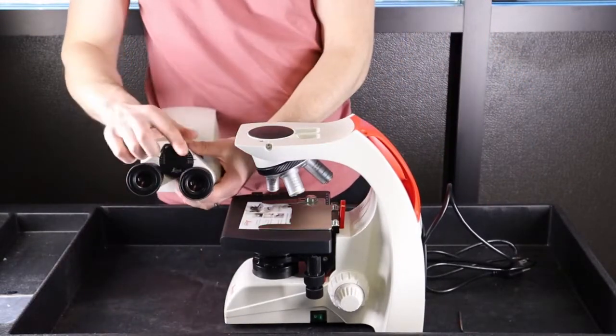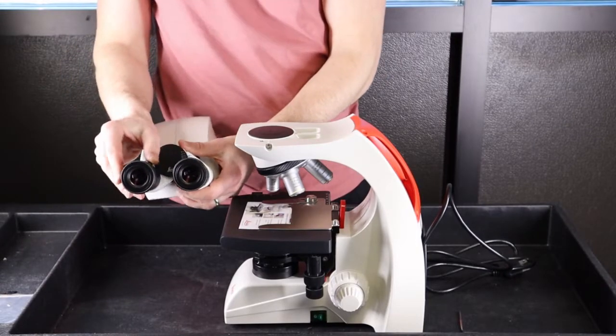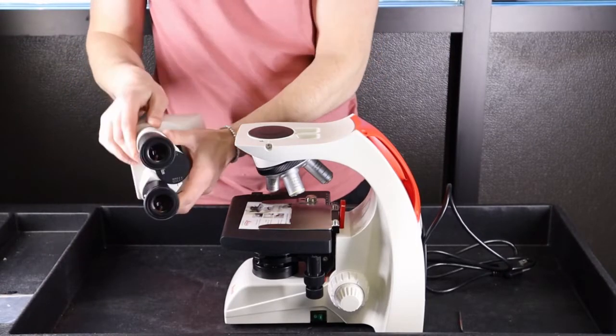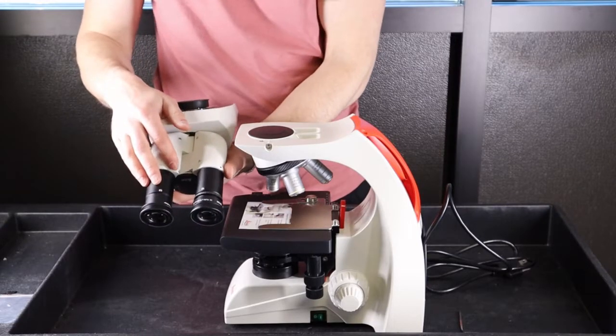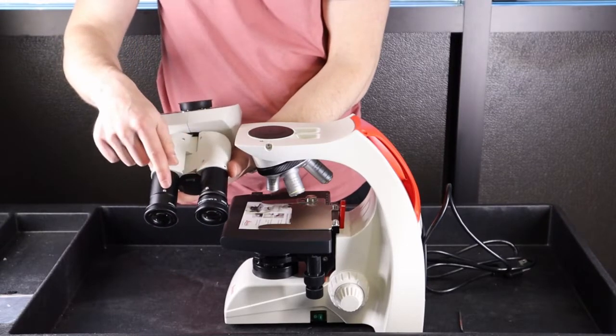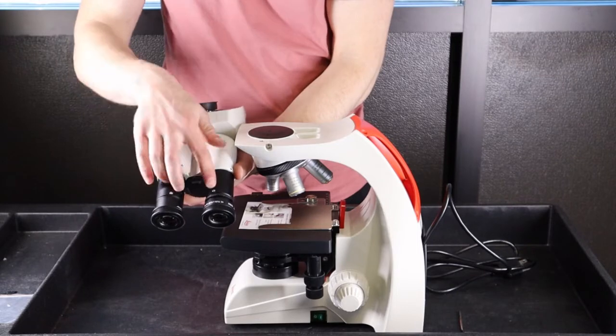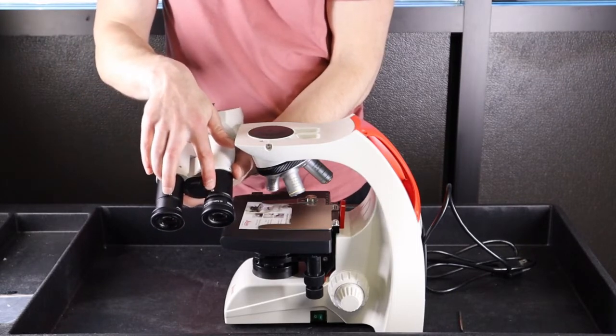We have the eyepieces pre-installed to make it simple and easy for you. Out of the factory they're not, but we open these up and pre-install the eyepieces. Should you need to remove the eyepieces for any reason, they're simply held in place by two Phillips screws underneath here.